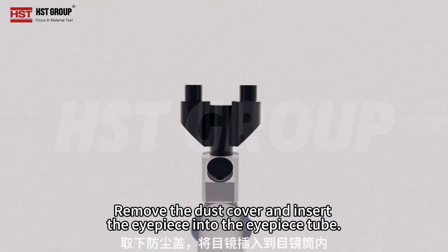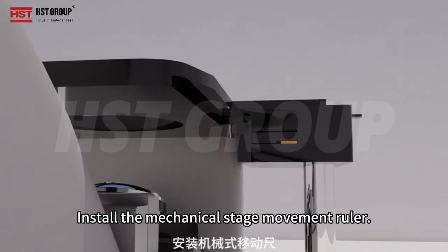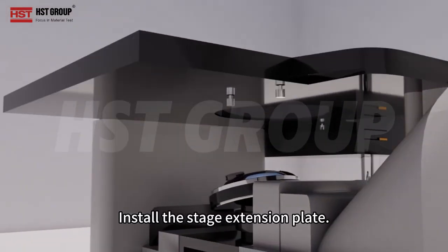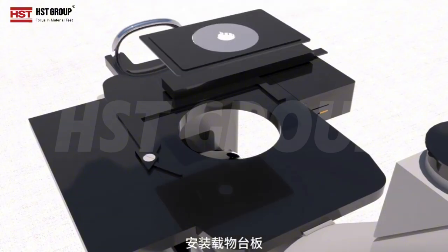Remove the dust cover and insert the eyepiece into the eyepiece tube. Install the mechanical stage movement ruler. Install the stage extension plate. Install the objective lenses in sequence. Install the stage.